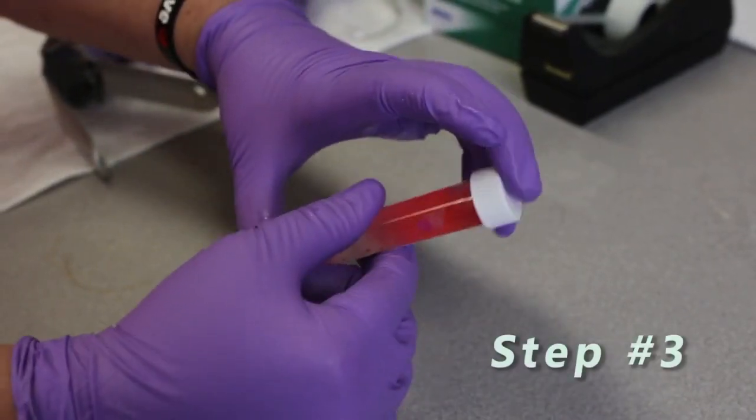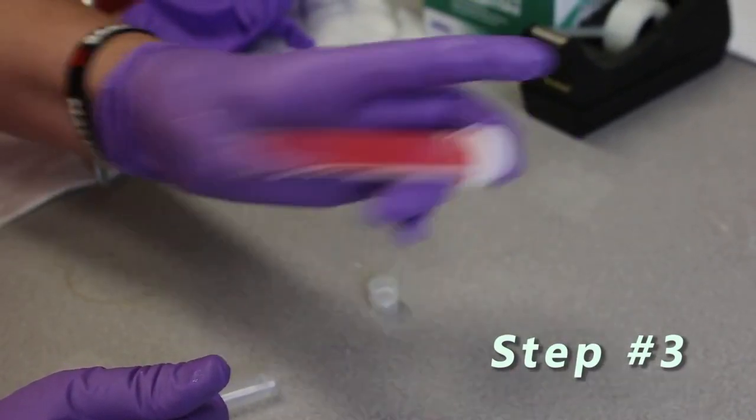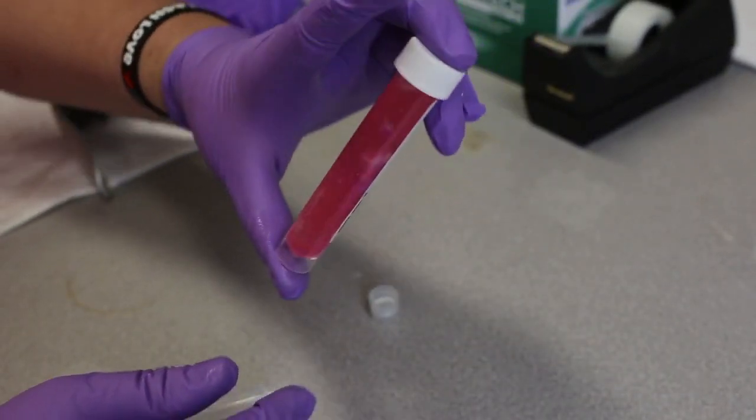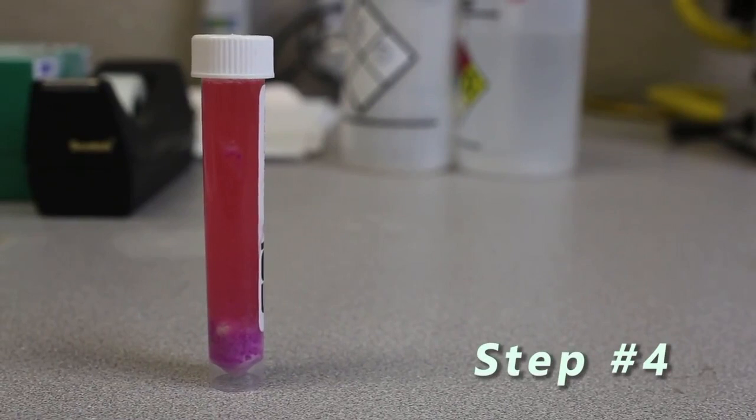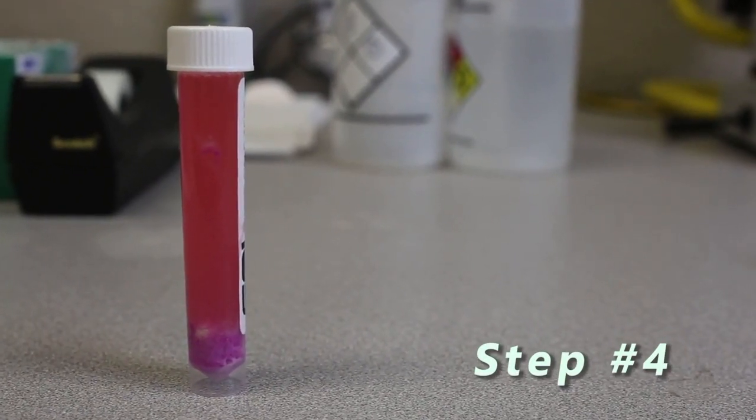Step 3, tighten the cap and shake well until completely mixed. Step 4, let the sample stand for 5 to 10 minutes.